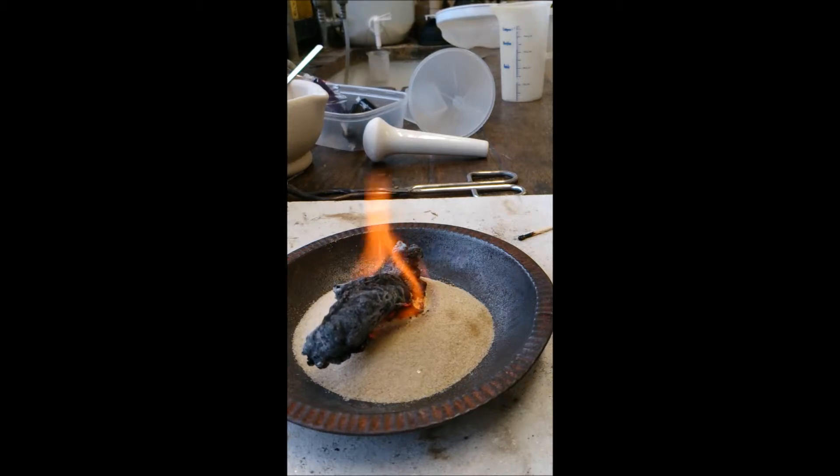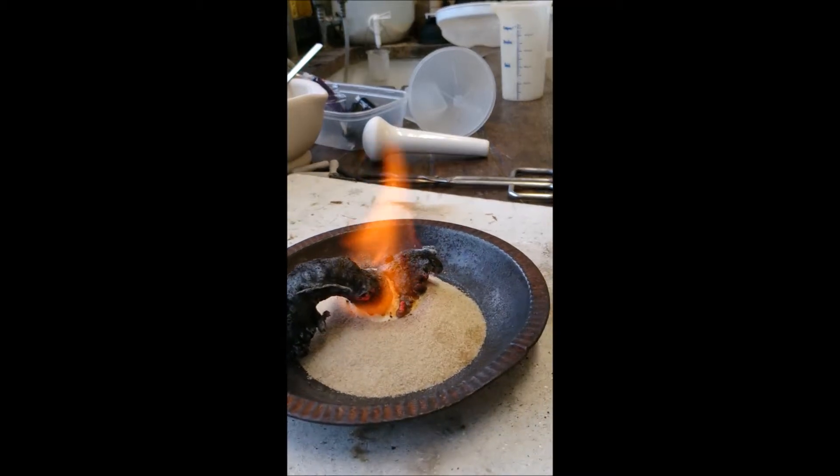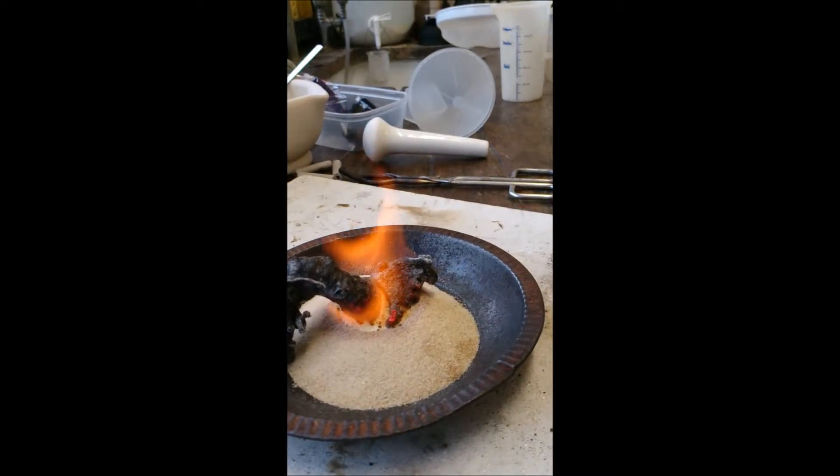You can't smell it at the moment obviously, but it does smell of burning marshmallows. Try and rotate it around a bit so you can see there's actually a separate one forming on the side there.